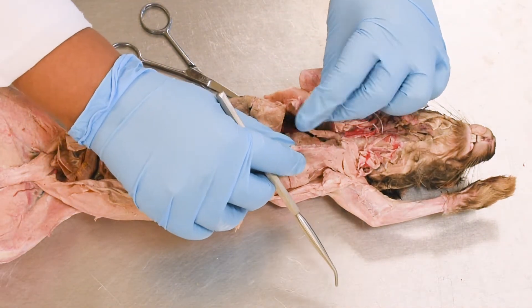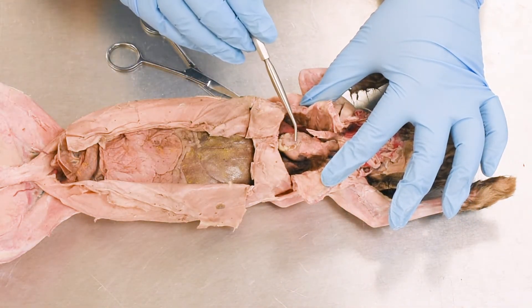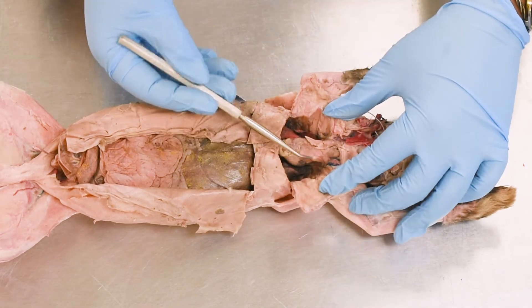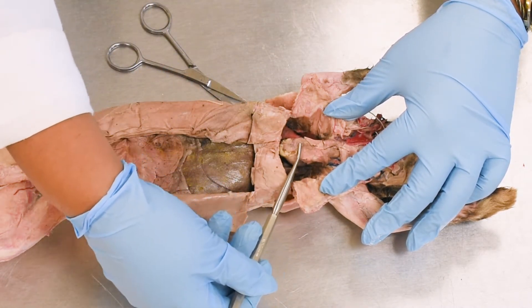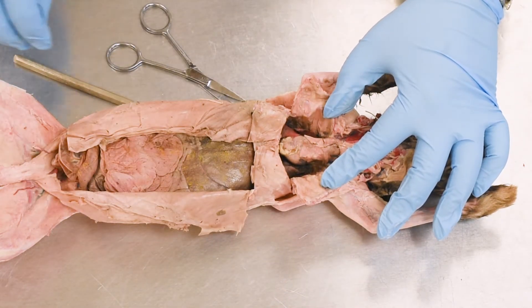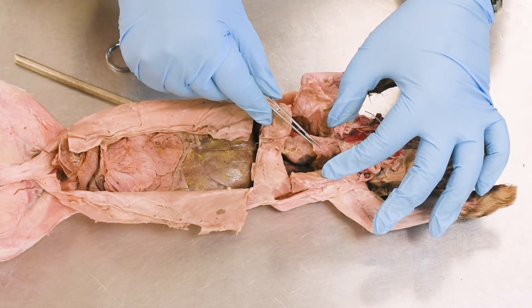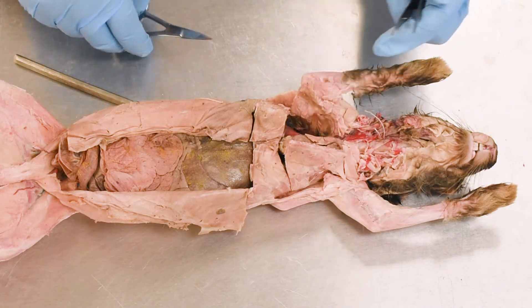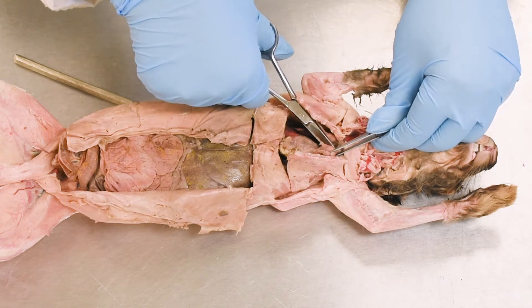Once you open the thoracic cavity, you will not be able to see the heart distinctly, because the very first organ you will see is the thymus gland, which covers the superior part — almost half the area — of the heart. So what we have to do is remove the thymus gland. Every trimming or dissection must be done very carefully so that we do not damage any blood vessels. So I am removing the thymus gland carefully.